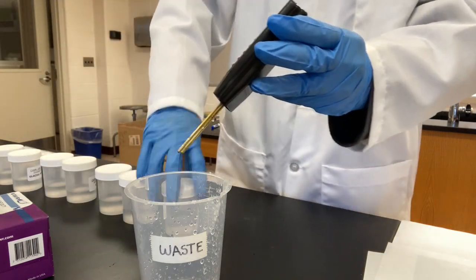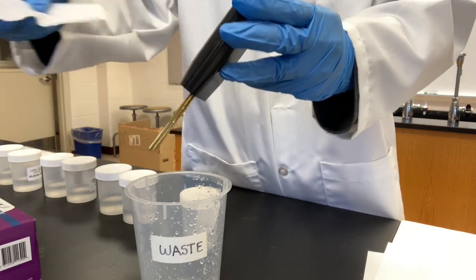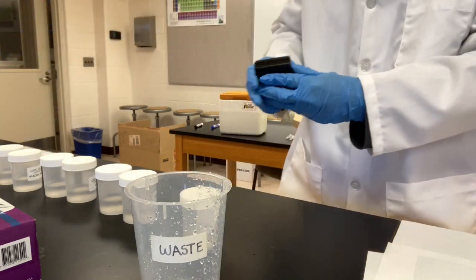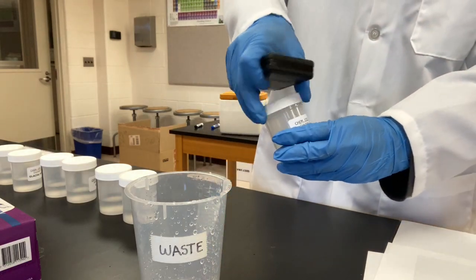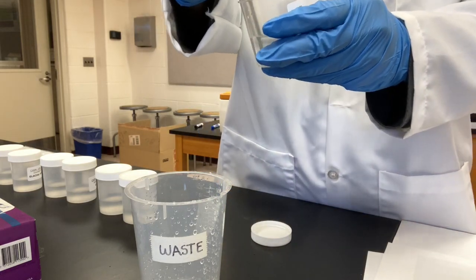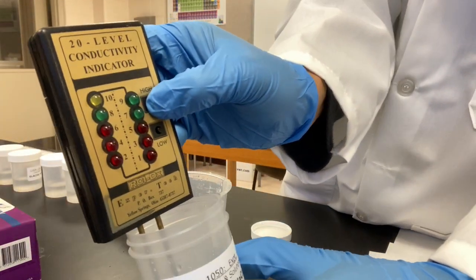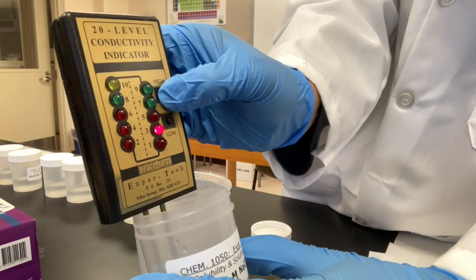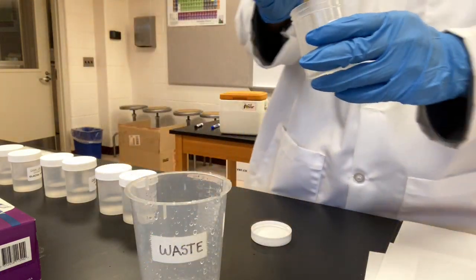Next one, 0.001 sodium chloride. High 3. High 3. Okay.